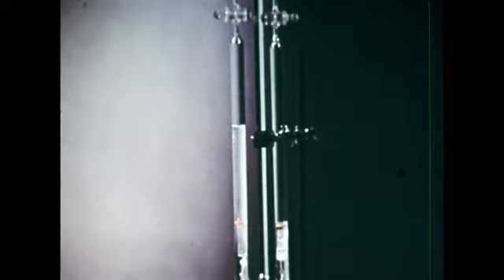Electrolysis of water is a common industrial method where power is available at little cost and other materials can also be sold. For example, electrolysis of salt brine can yield oxygen, hydrogen, chlorine, and sodium hydroxide all at once. You'll note that about twice as much gas formed on the right side from the negative pole as on the positive.